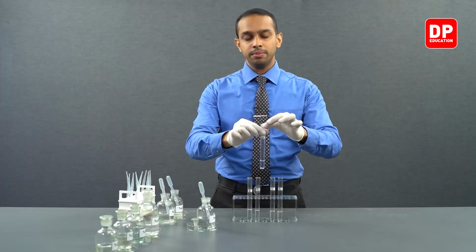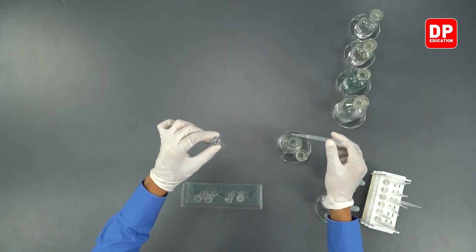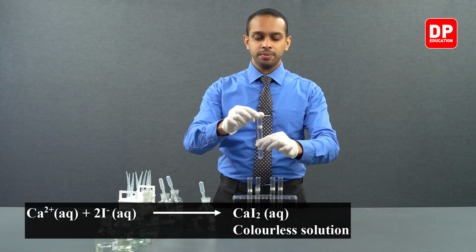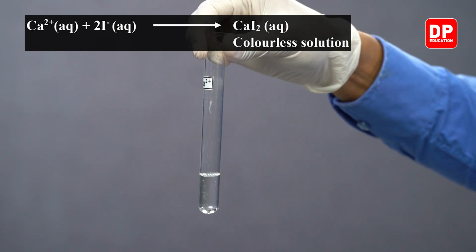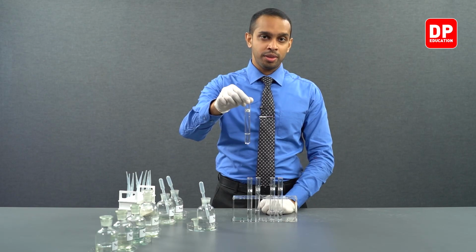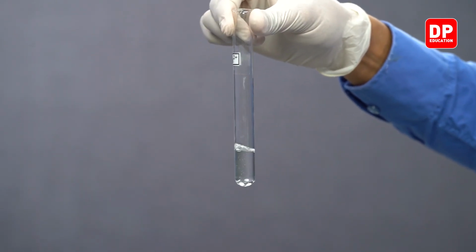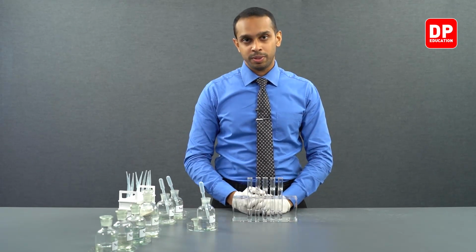We have our calcium 2 plus ion solution here. Let's add a small amount of sodium iodide into this. Now you can observe, when I add sodium iodide into calcium 2 plus ion solution, we do not see a precipitate. Calcium ions along with sodium iodide will form calcium iodide. And calcium iodide is soluble in water, so therefore you will not see a precipitate.